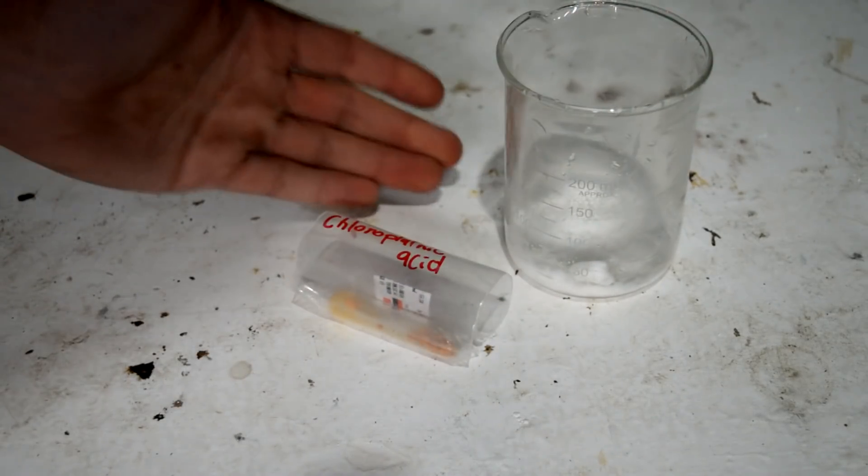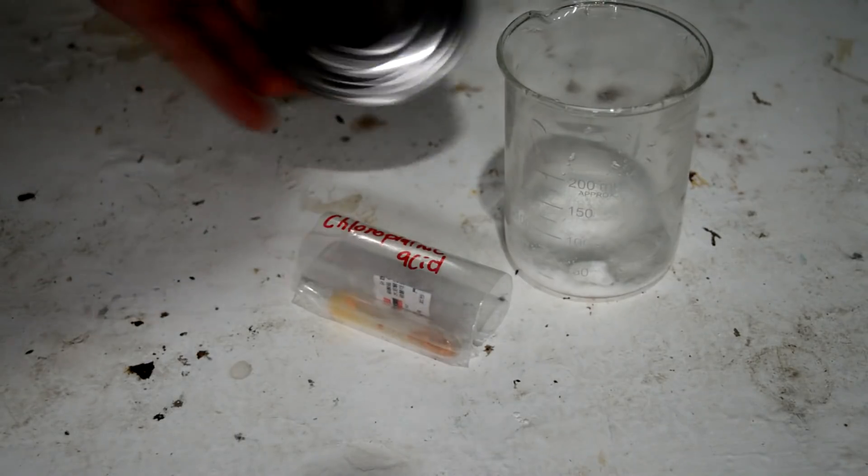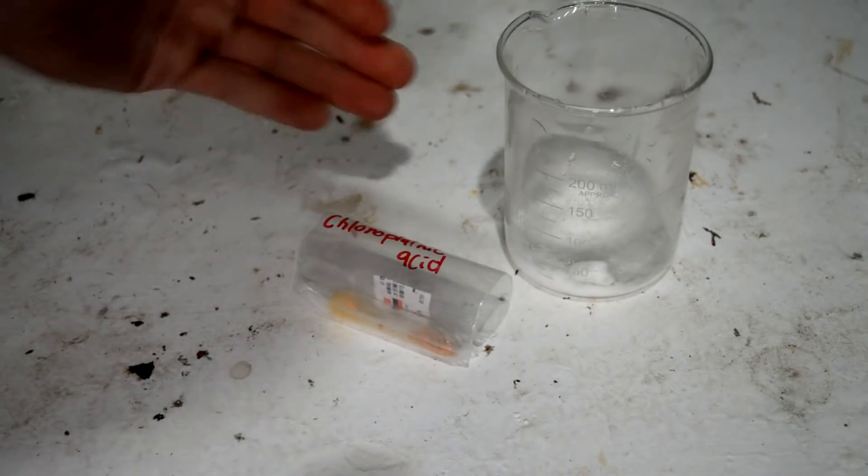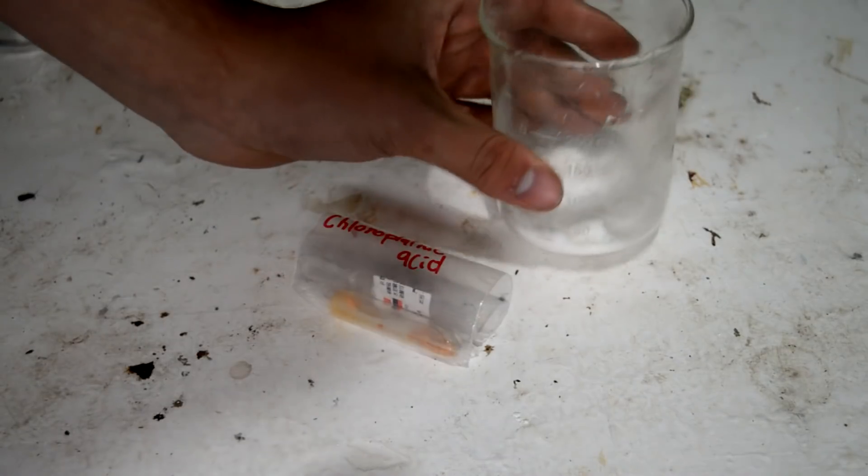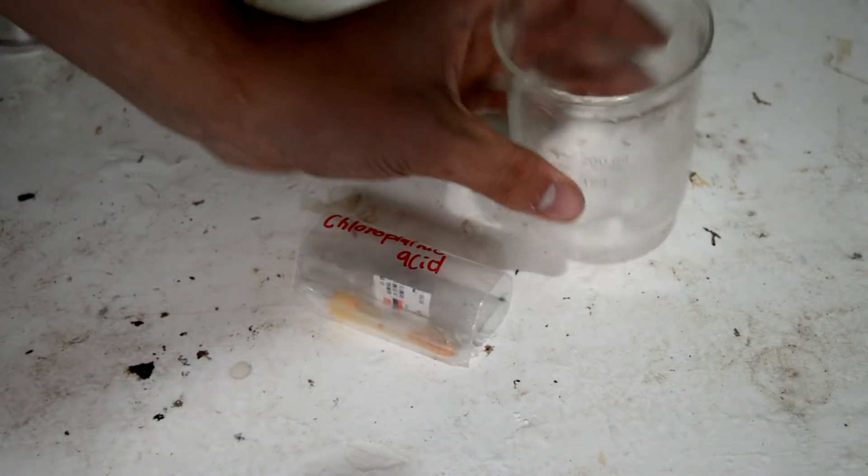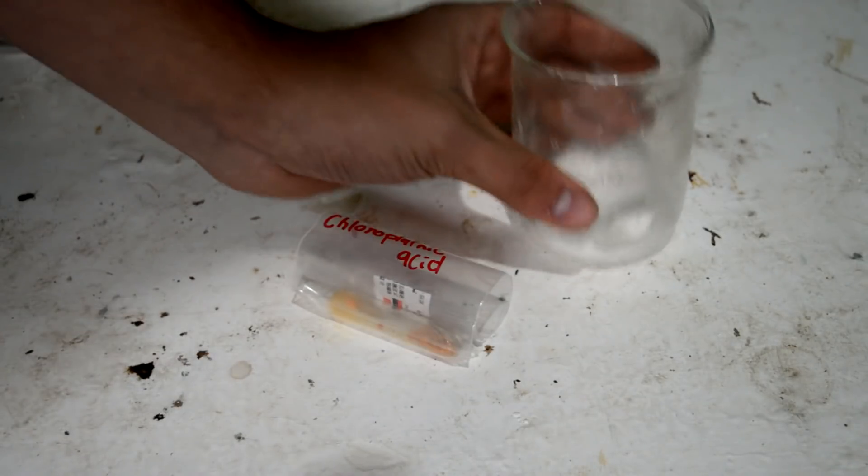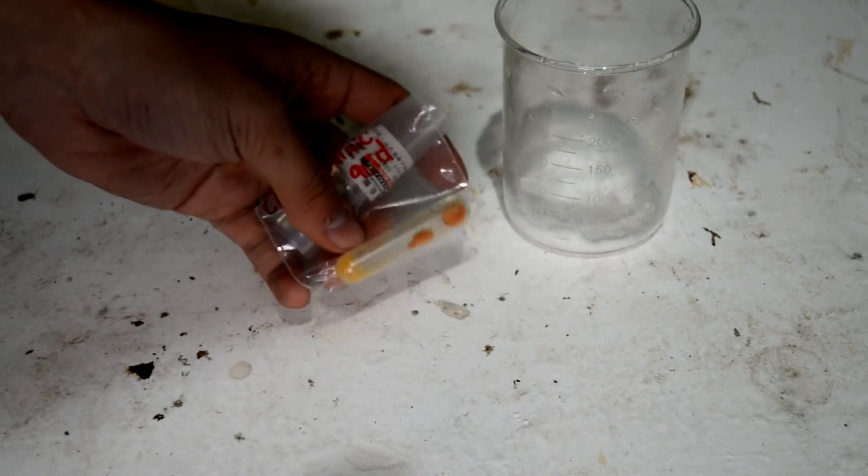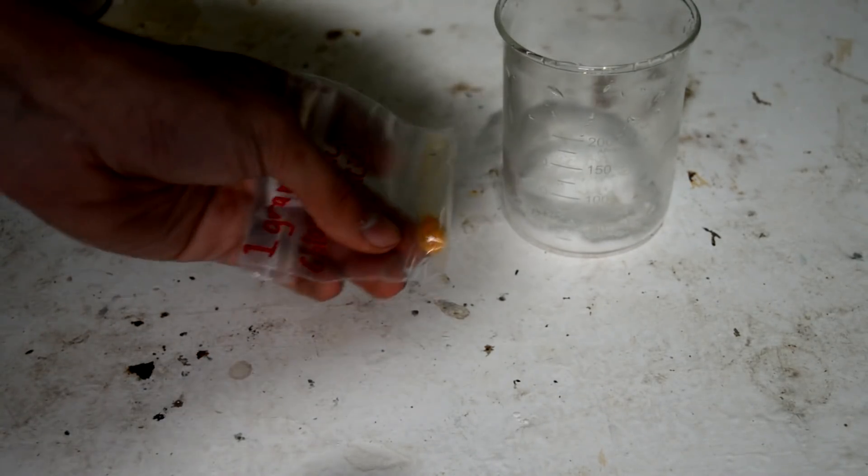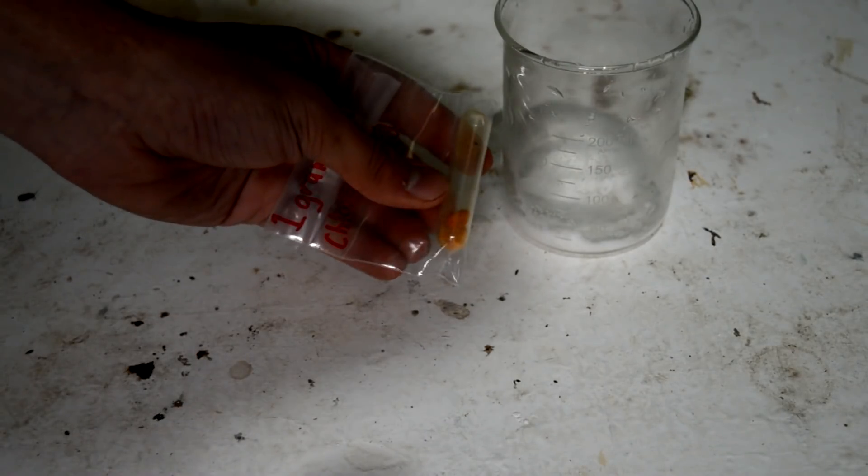But that's okay. We're trusting in our glass beaker here. Hopefully it's okay. I would prefer to do it in metal, but I think the chloroplatinic acid will react with the hot metal. So we're having to just trust in the glass here.